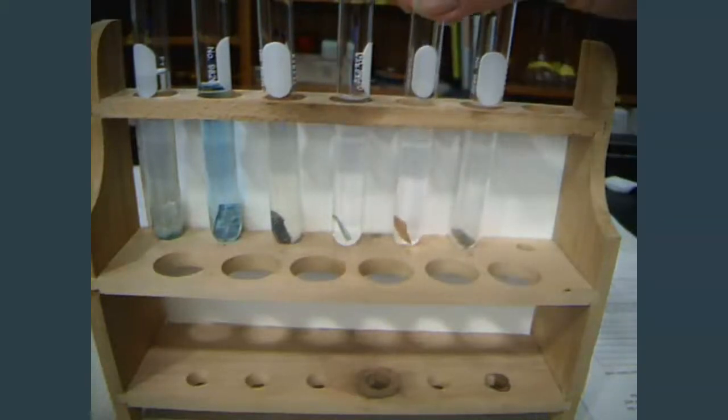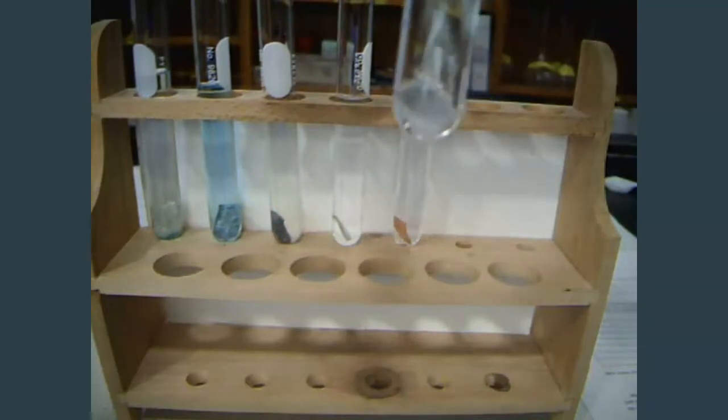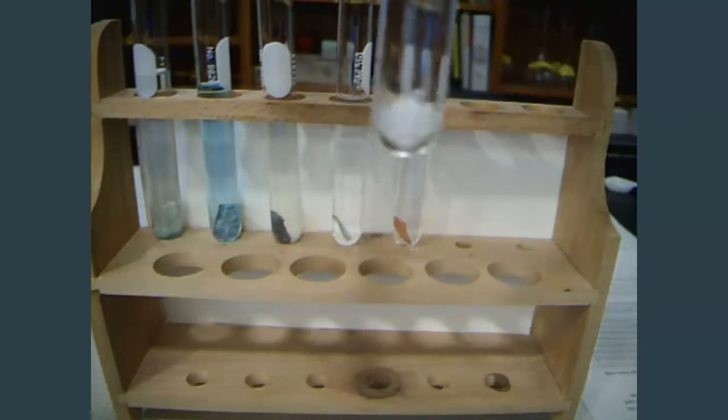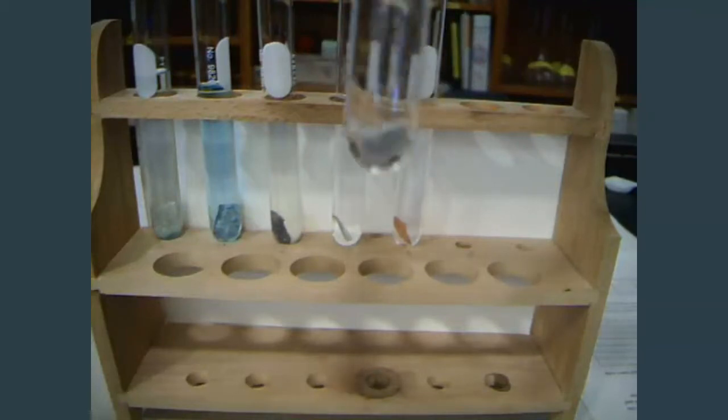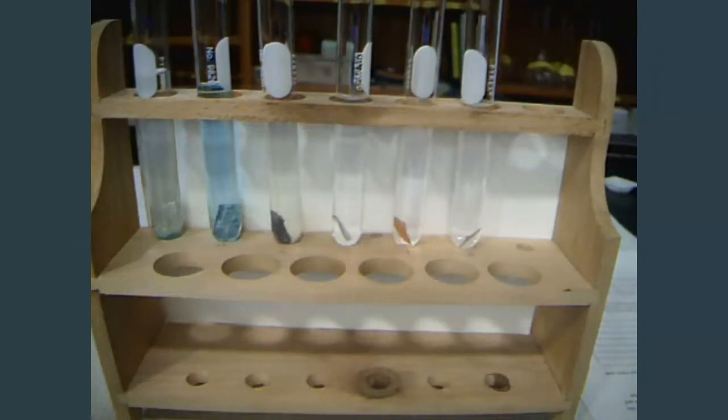Now, in the last one, this is the one that reacted pretty much instantaneously. And we can definitely see bubbles and a reaction going on. So, the hydrogen gas being generated from the reaction between the sulfuric acid and the zinc in there. So, now that we have those, we can go ahead and start filling out our sheet.